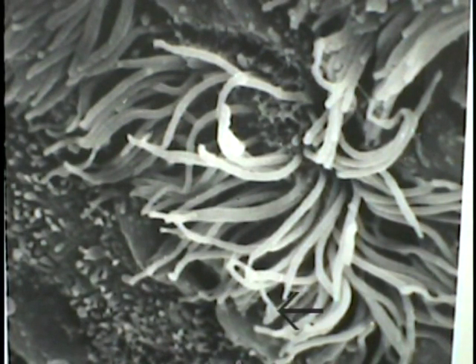Now, a high-powered scanning electron micrograph of the cilia coming off the apices of one of the tracheal lining epithelial cells. So this gives you a pretty good idea of the size and the overall nature of individual cilia as compared to these small structures shown somewhat in the background, which are the small microvilli coming off the apices of perhaps an adjacent goblet cell or a non-ciliated cell. So this clump of cilia is coming off the apex of a single epithelial cell.